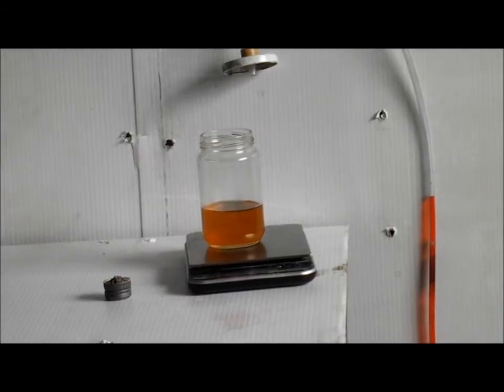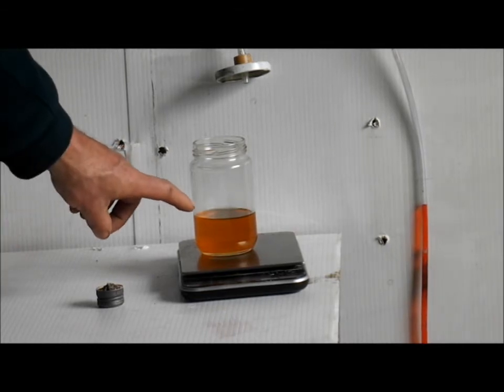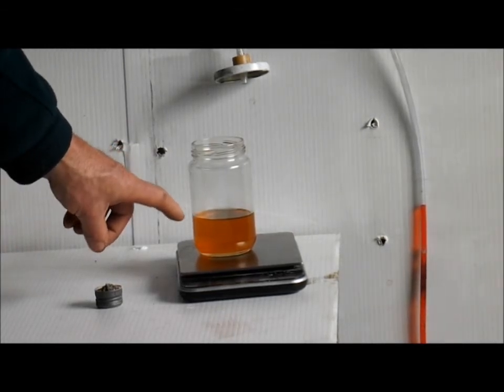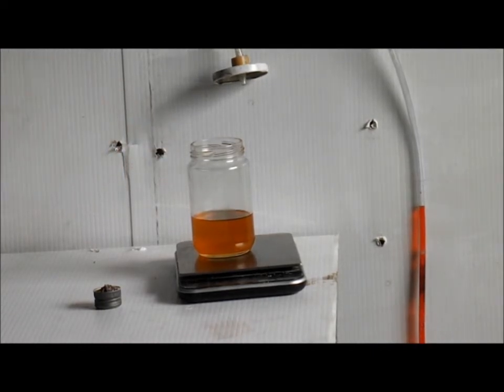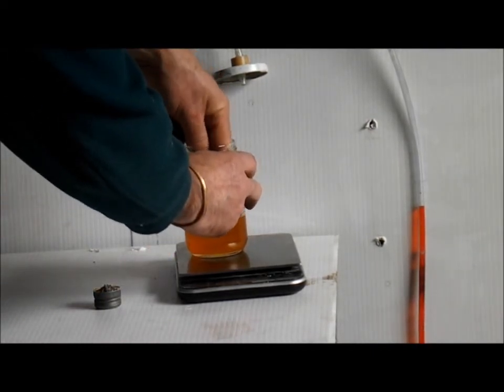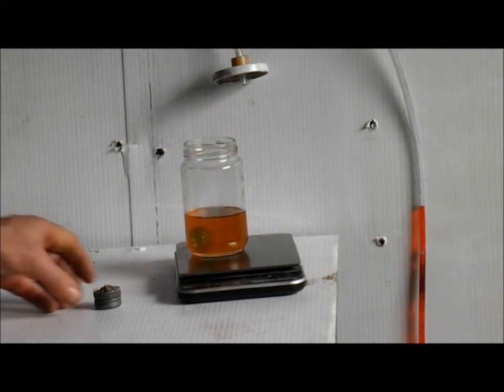To begin the test, you must first of all measure out exactly 100 grams of biodiesel using your scales. Then add a large glass marble. This is to help the biodiesel and calcium carbide mix. Two small ones will do fine.